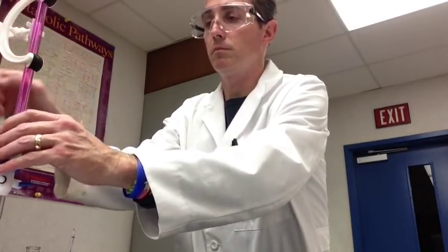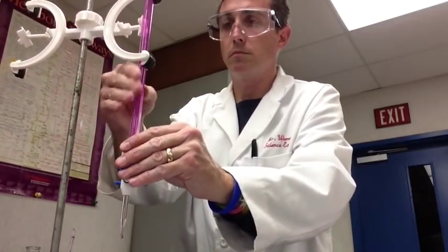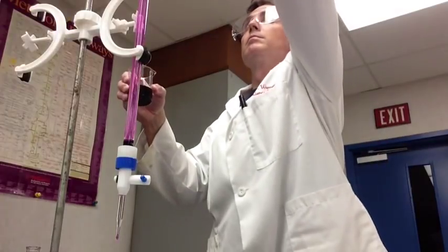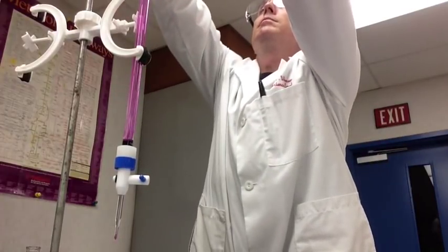Then you can put it back into the burette clamp and at this point you're going to need to fill it up. Now there can be a couple of you doing this and it might make it a little bit easier. You put the funnel in the top and you're going to add well over 30 milliliters probably all the way up to 50 if you can. It's going to go all the way up to the zero mark on the top because it starts at zero at the top and goes down to 50 at the bottom.